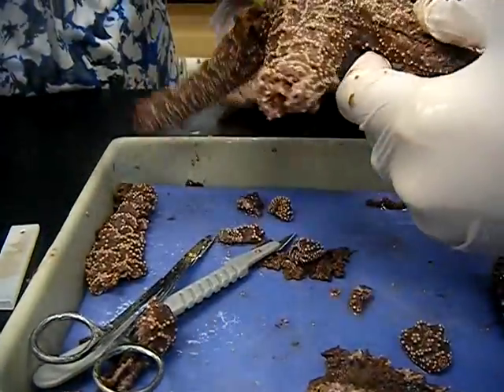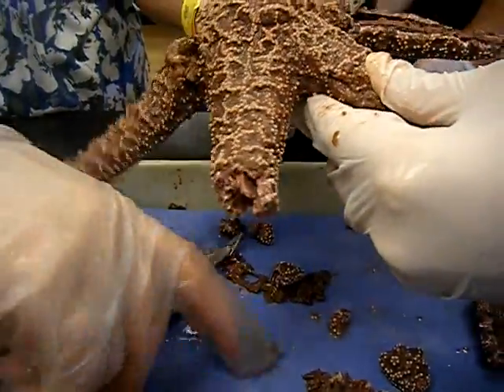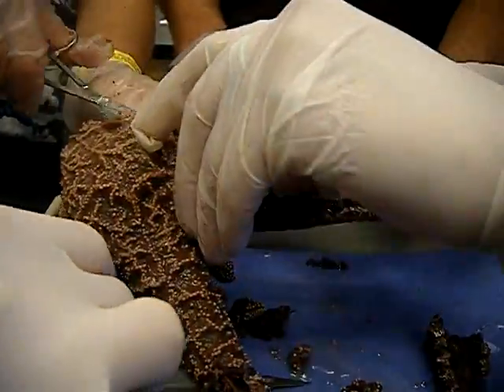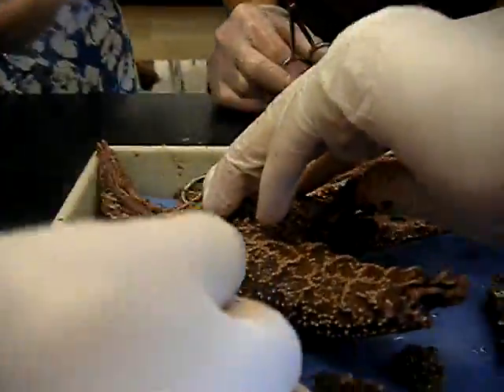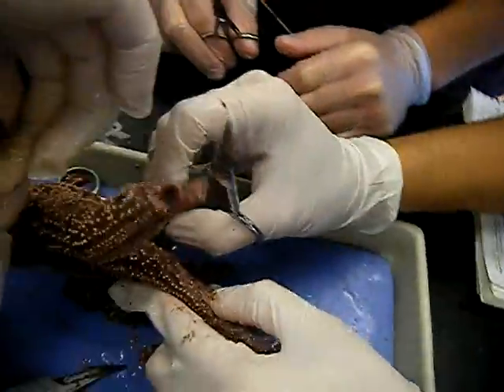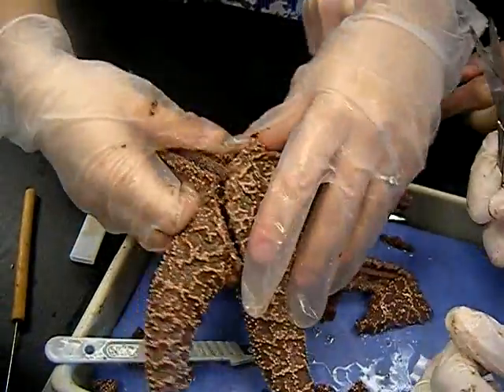Sounds yummy. Wait — hey guys! See, I was being delicate, and this is the leg I was actually working on. Gnarly. No, it's not. Let money on it. Fully intact my ass. Cut it on the bottom. Okay, here we go.